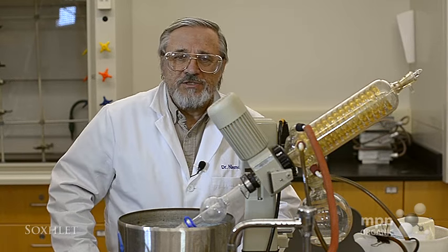I thought just for grins I'd like to see if we actually extracted anything with just two passes through the Soxhlet extraction procedure. So I took the solvent — methylene chloride — in that 250 mL round bottom flask and put it on a rotary evaporator, and I just removed the methylene chloride. Methylene chloride boils at 42 degrees, so it's really easy to get rid of. I just wanted to see if there was any residue in there, and there is an oily residue. I'm going to let that go for a short while to get most of the methylene chloride off and see if we can solidify this material, because after all, trimyristin is a solid.